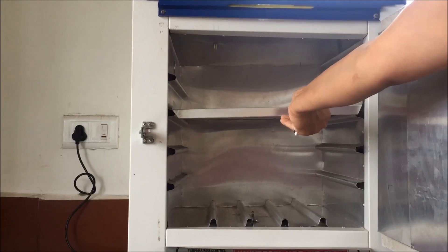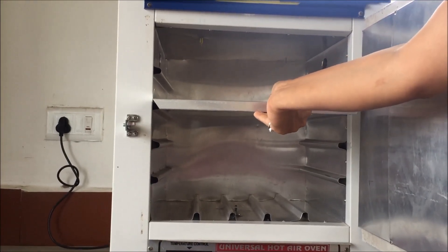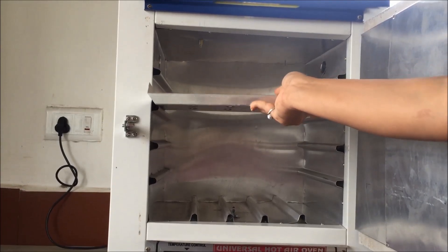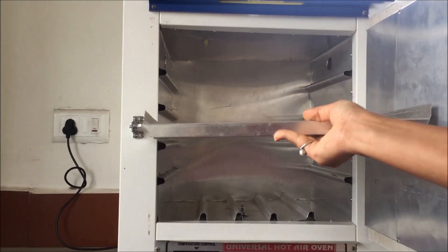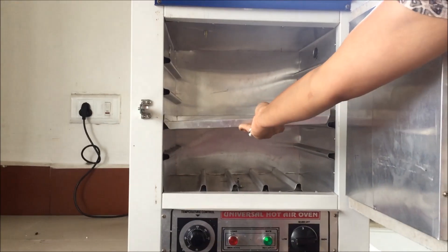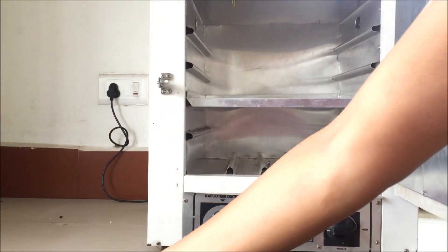The thermostat is a device which controls the temperature by maintaining it. If the temperature exceeds your set point, it will auto cut-off. And if the temperature decreases, it will restart. Now for better visualization, let's move the tray from the top rack down one level.